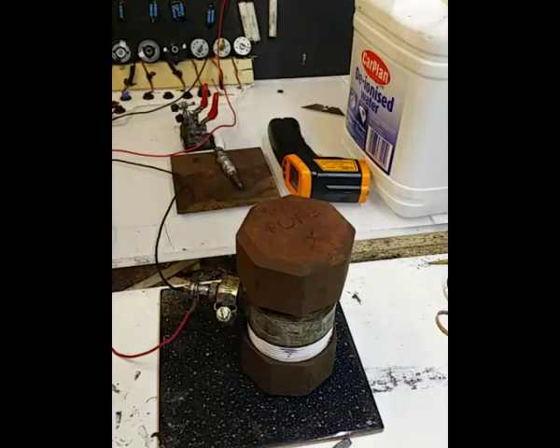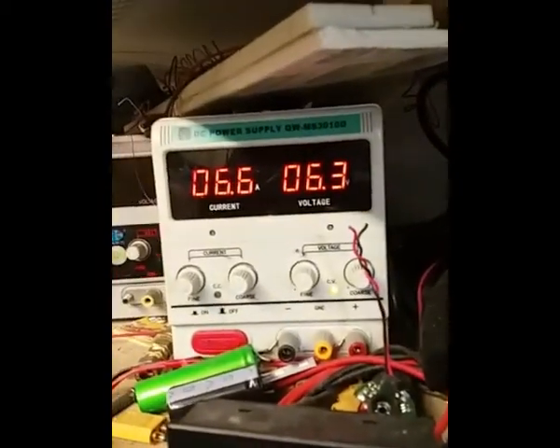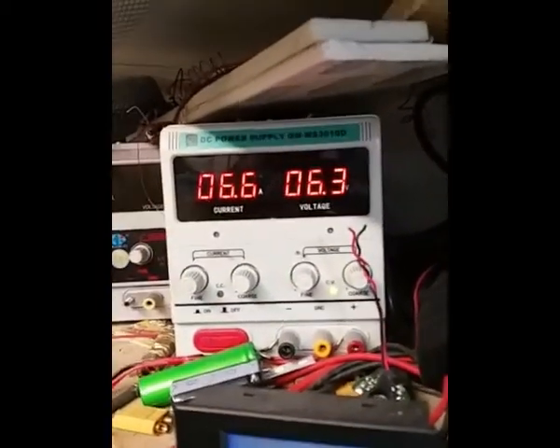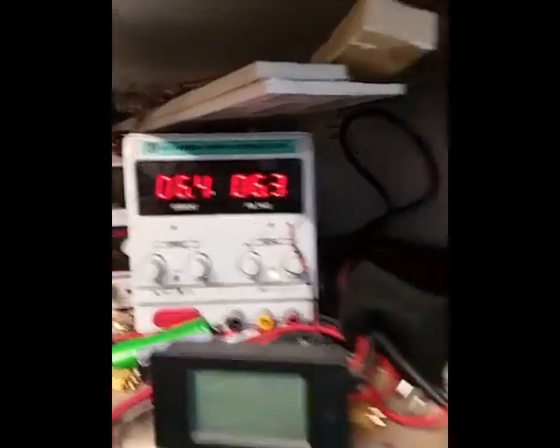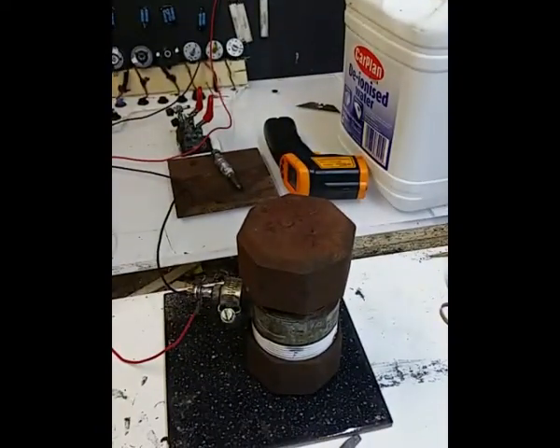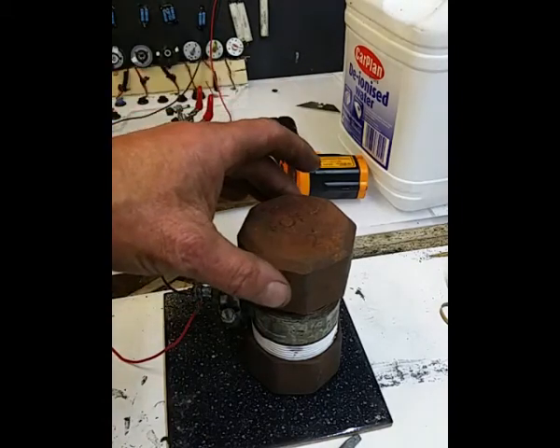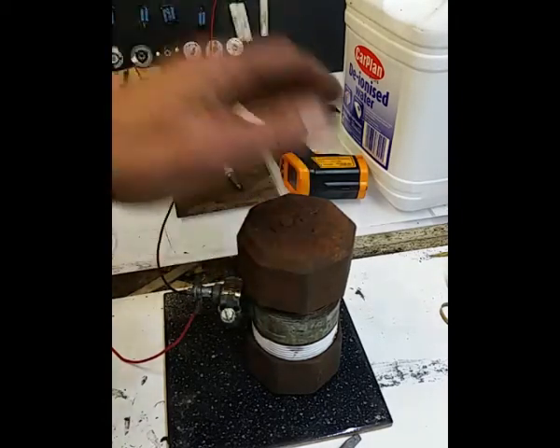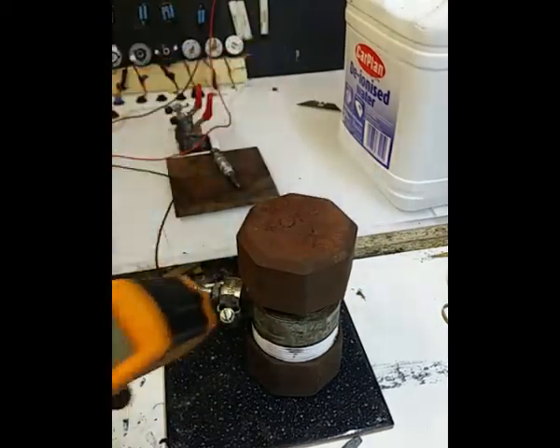At the moment I've got 6.3 volts, and we're drawing, well, I'll show you, 6.7 amps. Now obviously as that heats up, the current will go down as it is now. So there we go. Now obviously what I've got to do is initially heat this up, and that is now getting hot. That was quick.